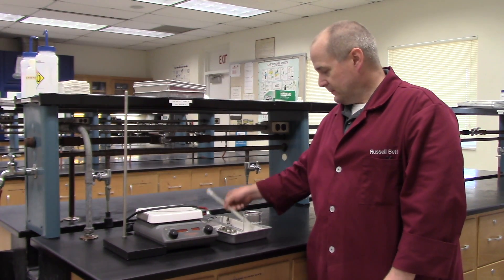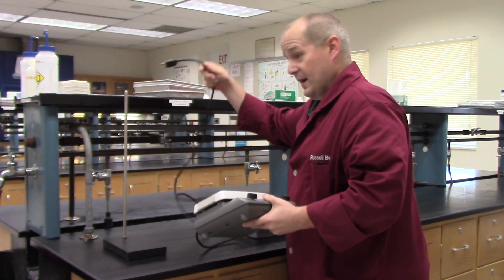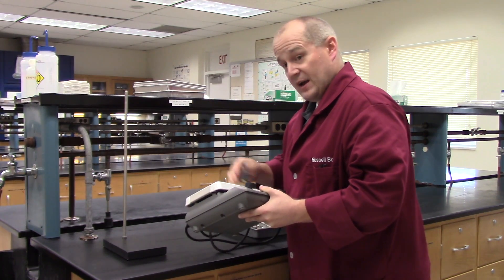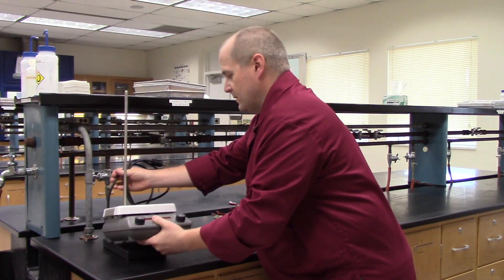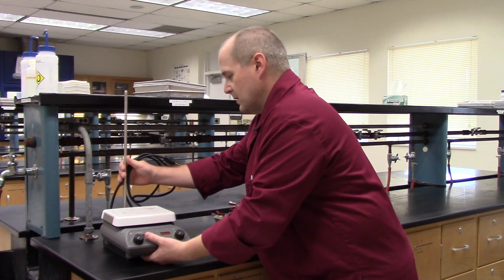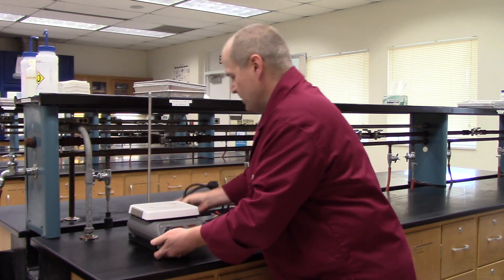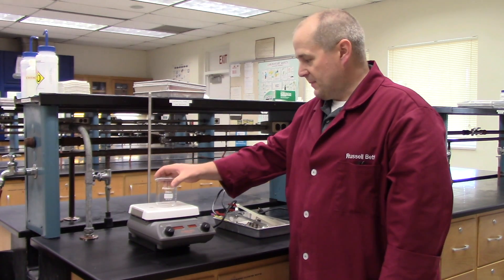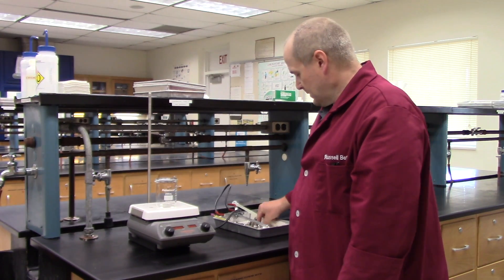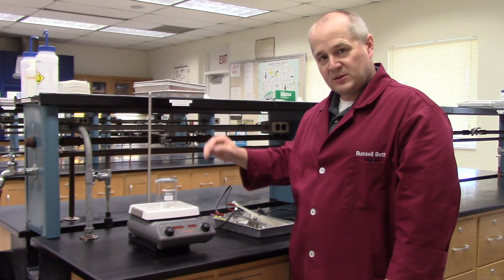Move the clamp stand out of the way a little bit. Take the hot plate while it's still cold and not plugged in — don't burn yourself — and set it on top of the clamp stand. Don't plug it in just yet. You don't ever want to plug in a hot plate until you're absolutely ready to use it. Put the beaker on top of the hot plate. Take the little Teflon wrapped stirring bar — the magnet — and place it inside the beaker. Don't throw it in, just drop it in nice and gentle.